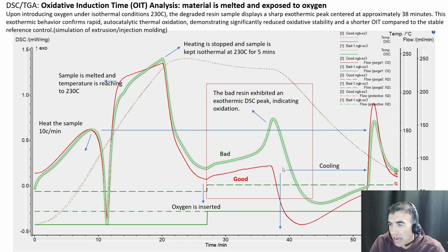After about 37-38 minutes, the test is finished, the cooling starts, and basically the test is done. These tests show that the bad resin has already experienced compounding conditions that consumed its thermal stabilizer. So either there is not enough thermal stabilizer in the compound, or the compound has already been at the edge of thermal oxidation.